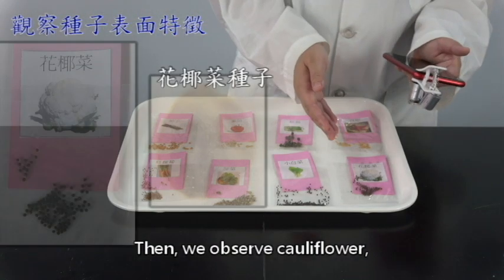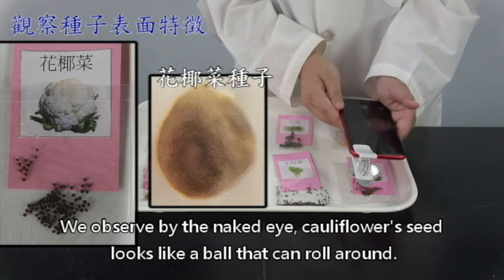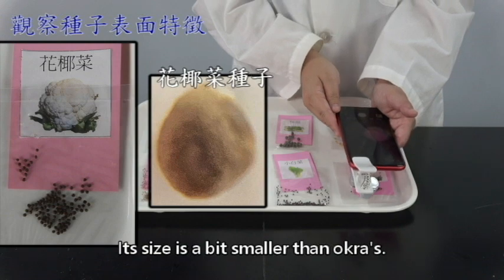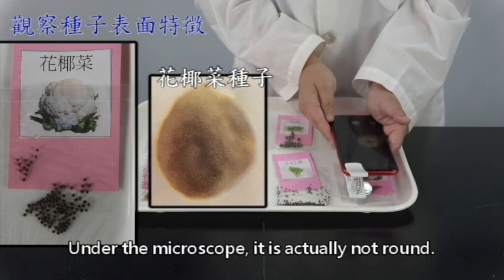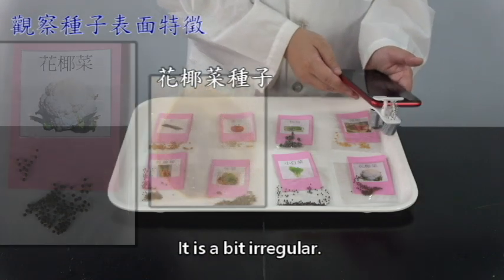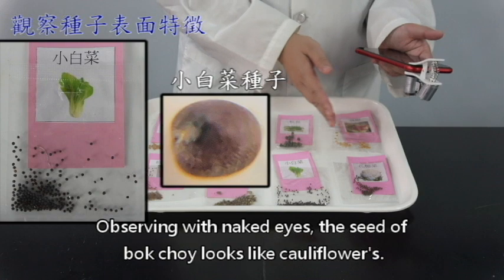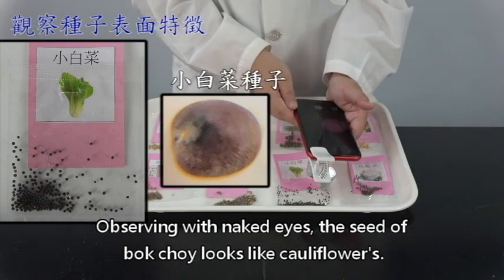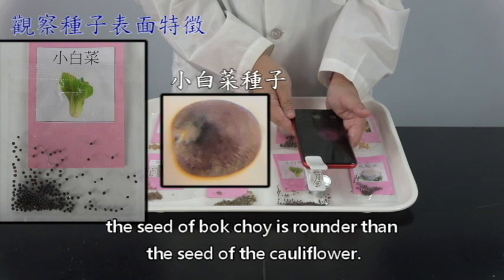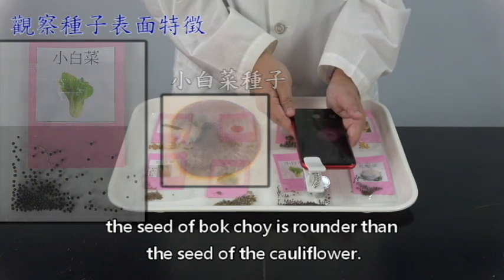Then we observe cauliflower. We observe by the naked eye. Cauliflower seed looks like a ball that can roll around. Its size is a bit smaller than the okras. Under the microscope, it is actually not round. It is a bit irregular. Observing with naked eyes, the seed of bok choy looks like cauliflower's. Under the microscope, we see that the seed of bok choy is rounder than the seed of cauliflower.